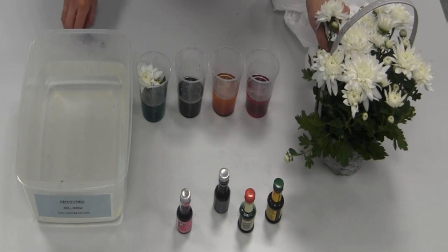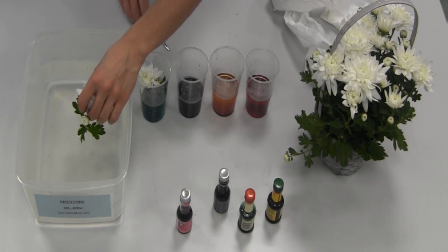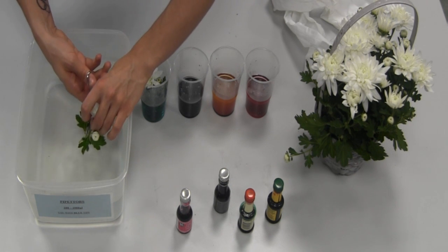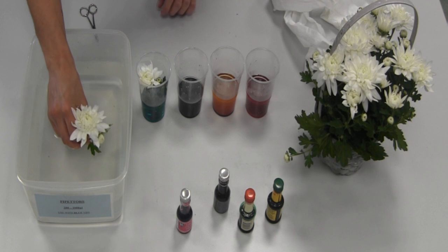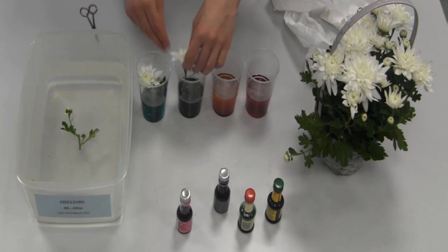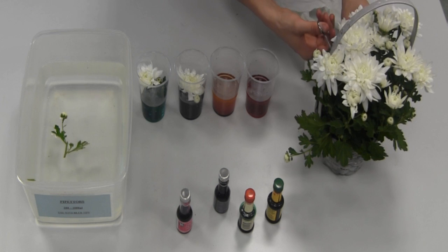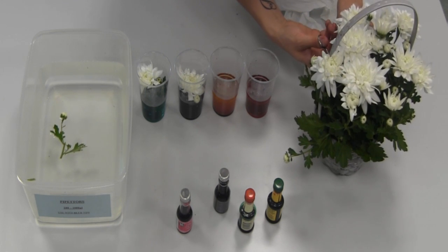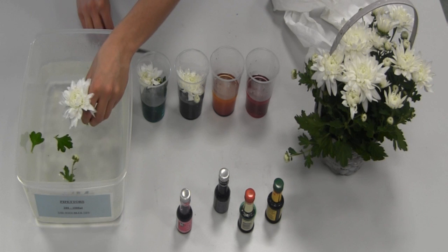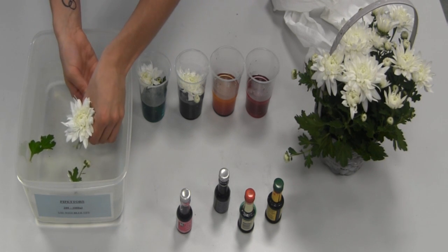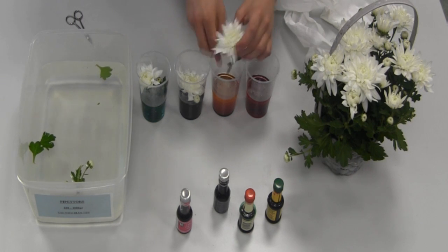So, the reason you place in the water and then cut at an angle is because air bubbles get in the stem, preventing the plant from sucking up the water and transporting it to the petals. As you cut the flower, you may see some air bubbles released. Make sure you pinch it as it goes across.